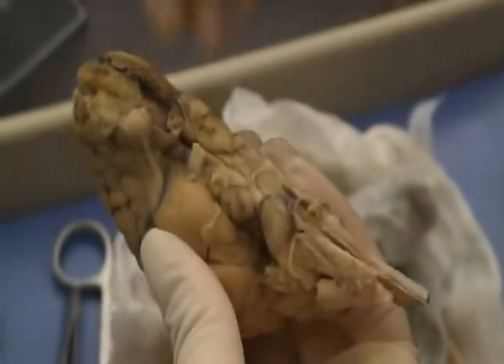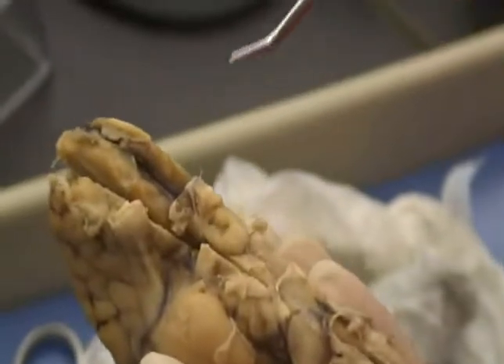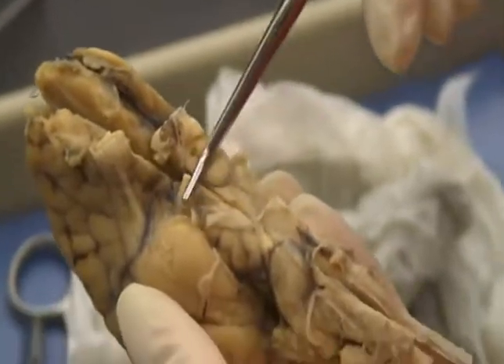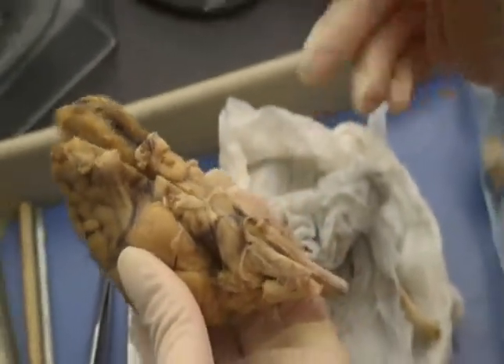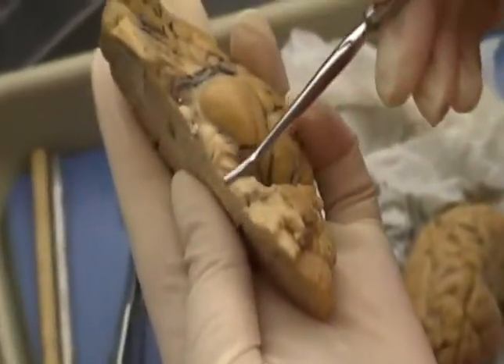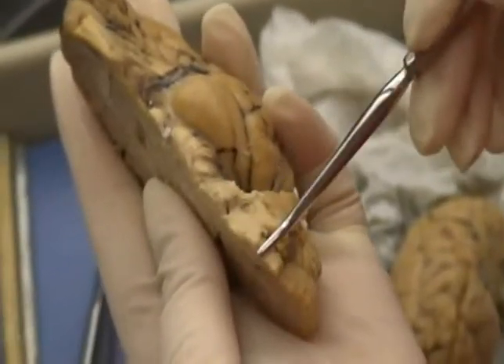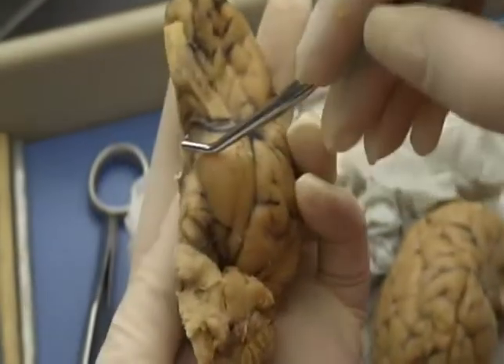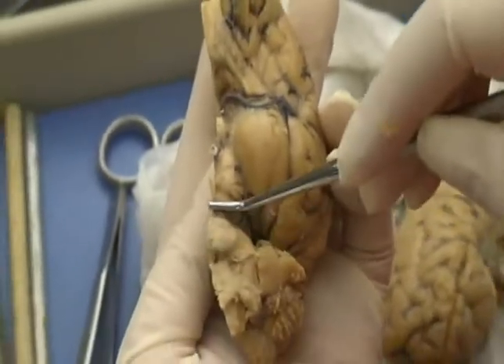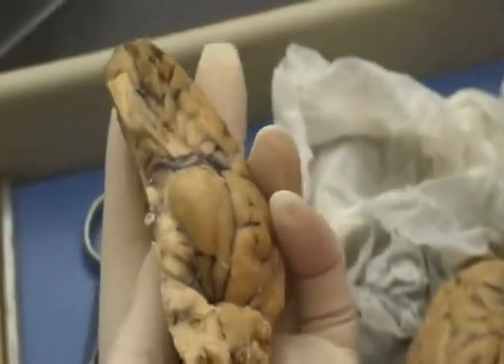Mammillary bodies are right here, right there. Okay. The cerebral peduncles are right around those, right there. The pons, let's take this side. The pons is right here, this swelling. Right here's your peduncles, here's your pons, here's your medulla. So you have the mammillary bodies, the cerebral peduncles, the pons, and the medulla. Okay. And in the medulla, you have your cardiac center, your vasomotor center, your respiratory center.